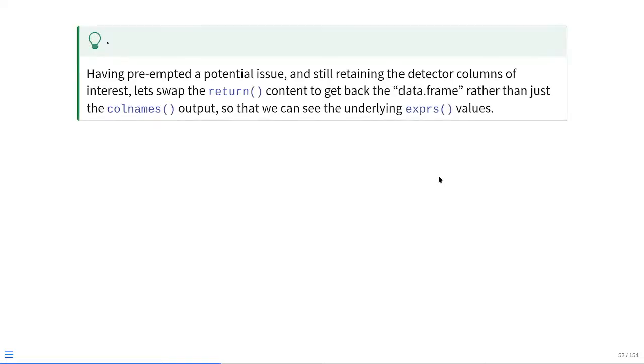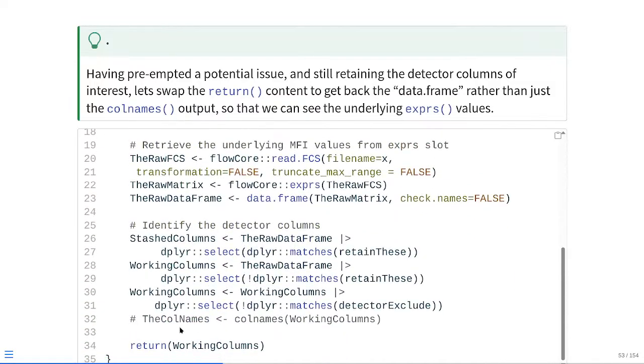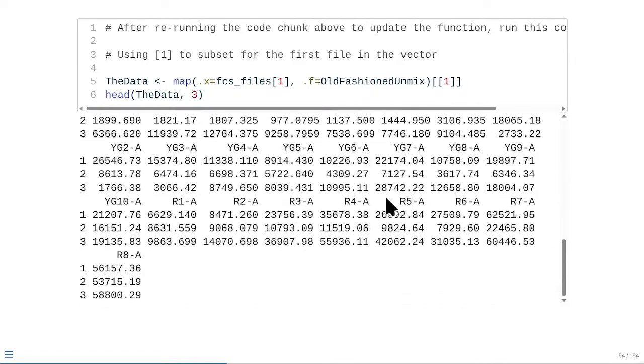So, having preempted a potential issue and still retaining the detector columns of interest, let's go ahead and swap out the return content to be a data frame instead of the column names checks that we've been doing so far, so that we can actually see the underlying exprs values that are being retained. So at this point, everything else remains the same, and in this case, we're just switching it out. Instead of returning the column names, we're now returning our working columns object within the function, and then at that point, we should be able to see the exprs values. So at that point, refresh the function, rerun our output line, and we're back to seeing just the detector columns, the things that we actually need at time of our unmixing.